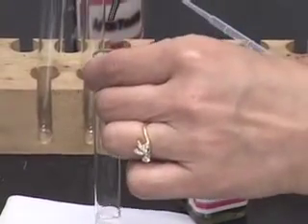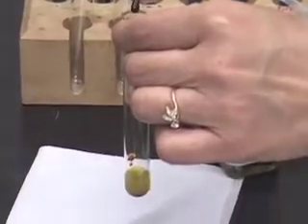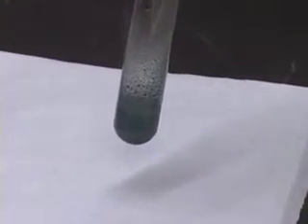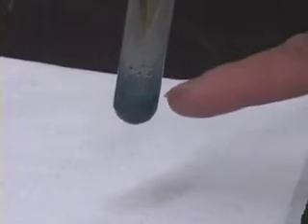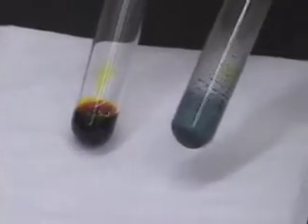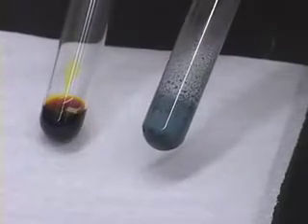Add two drops of the chromic acid test reagent and mix the two. Notice what happens to the test tube contents. You notice that there is a nice, opaque, blue-green precipitate. This is the test tube which has the test compound, 1-butanol, which is a primary alcohol.